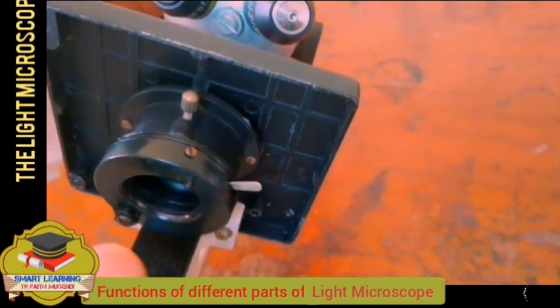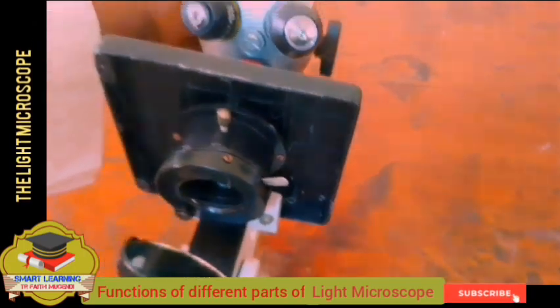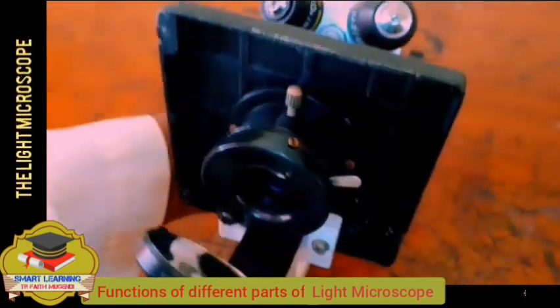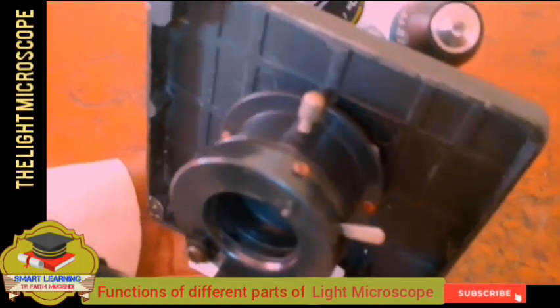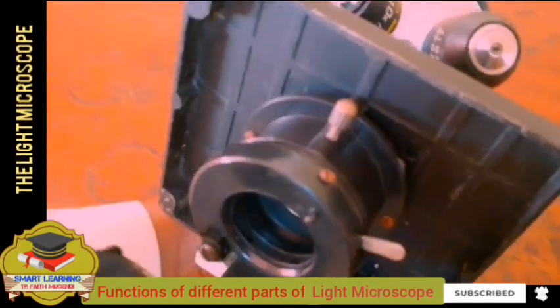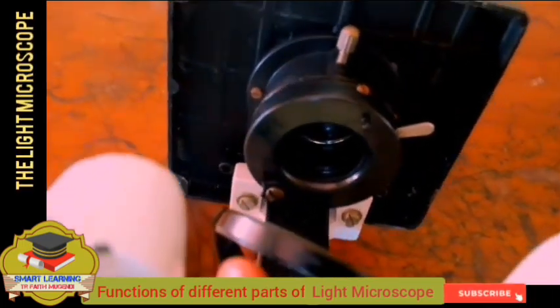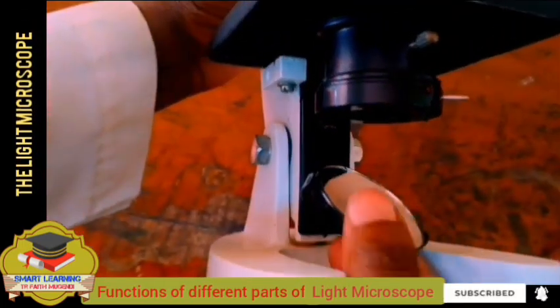The next thing that we are going to talk about is the condenser. When we talk of the condenser, we are talking about a system of lenses. If you keenly look at the inside, but because of the mirror, if you allow me, I remove the mirror because it's removable.